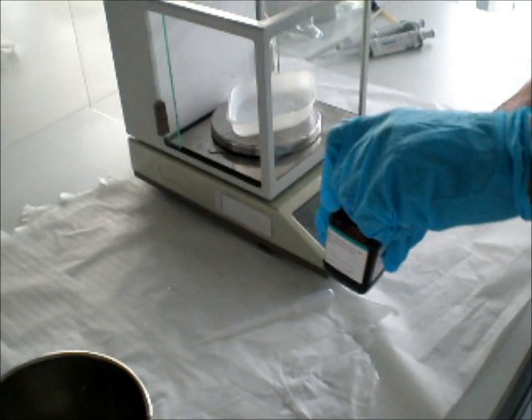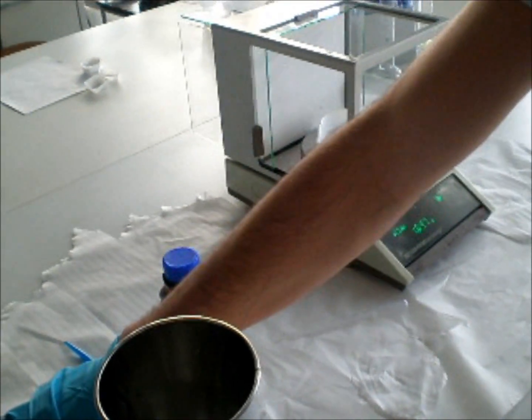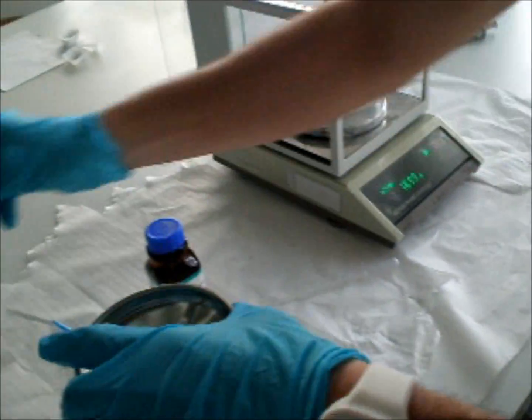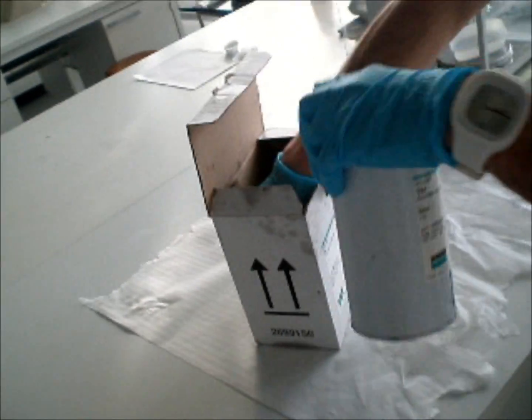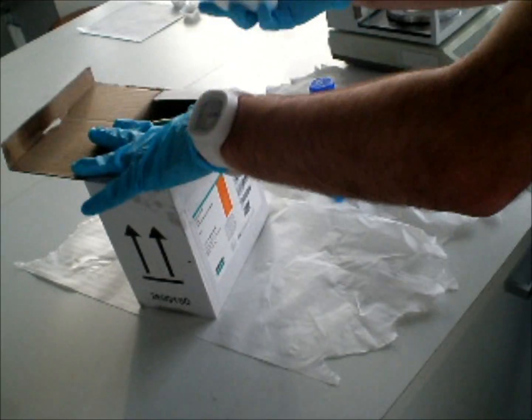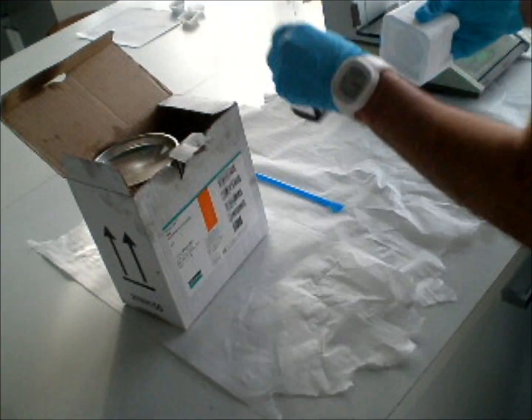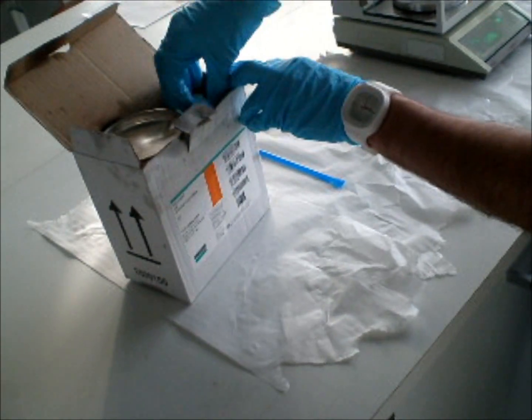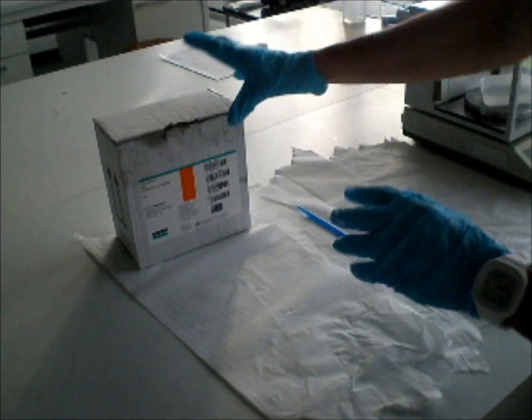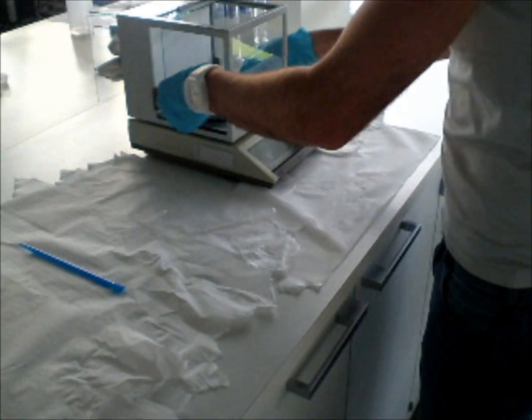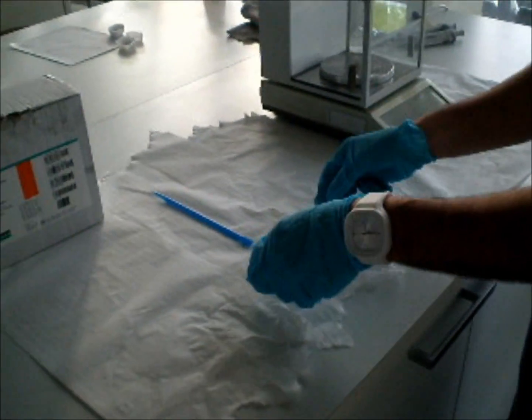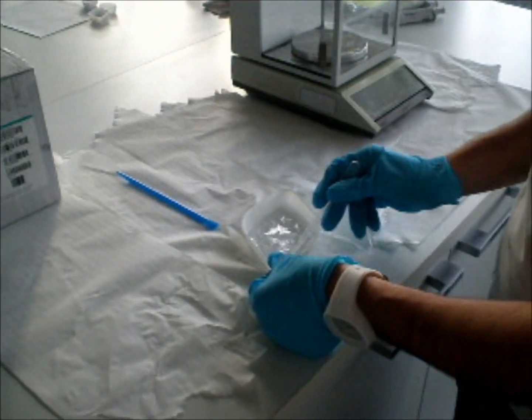And then, once we finish, we close everything. We cut it all nicely. So, we close the container, we take it out, and very gently, we start mixing it.